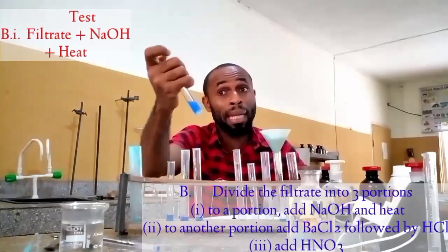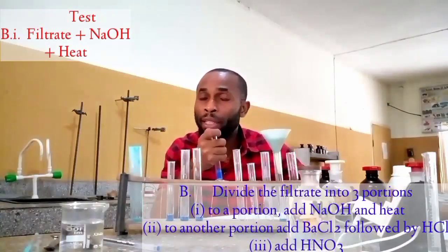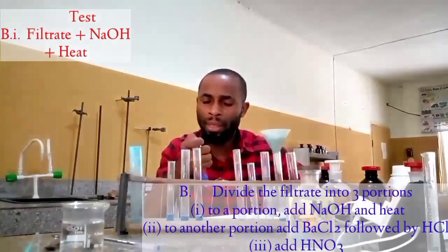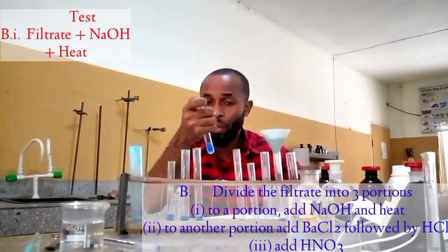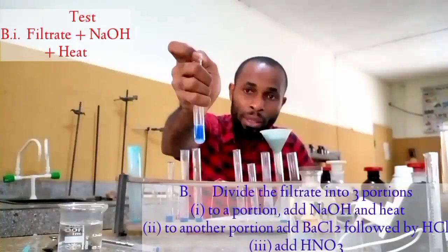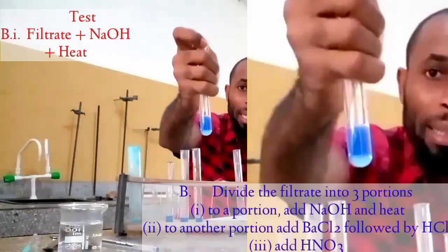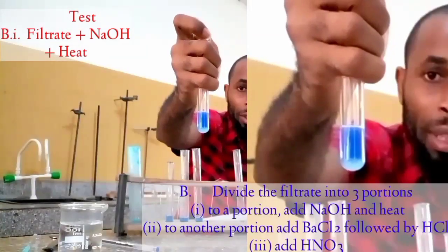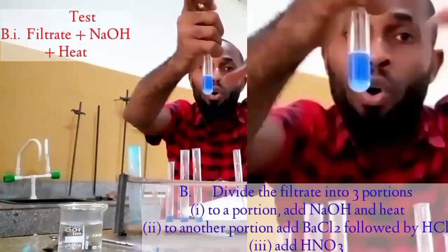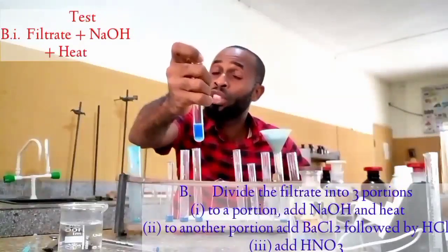Even when you heat it, it will still take time before you notice the reaction occurring. And if you bring it close to your nose, as I just did now, a choking gas comes out, proving that ammonia is present. I don't know if you can see that the reaction has actually started. Because when I touch this, it's now hot. It's very, very hot. Just the same way as using your heater.